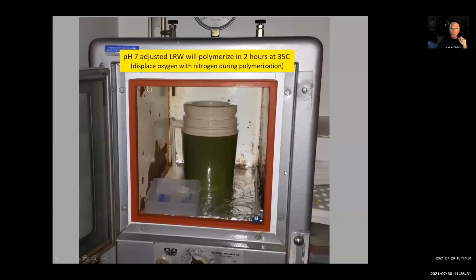So what we set out to do then was to embed our tissues in LR white, adjusting the pH of LR white to pH 7. We also recognized that pH 7 LR white will polymerize in about 2 hours at 35 degrees centigrade. So 60 degrees centigrade was no longer necessary. We do need to displace oxygen in the polymerization chamber with nitrogen. So here we have liquid nitrogen bubbling off gaseous nitrogen, or we could fill this chamber with gaseous nitrogen through our valve systems at the top with this vacuum oven.